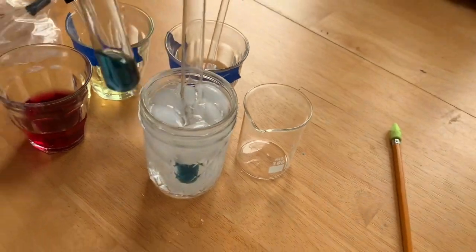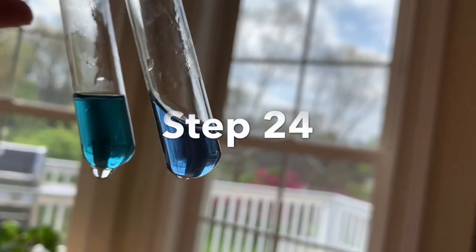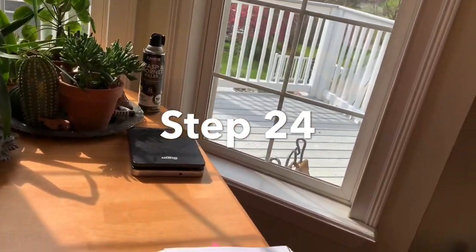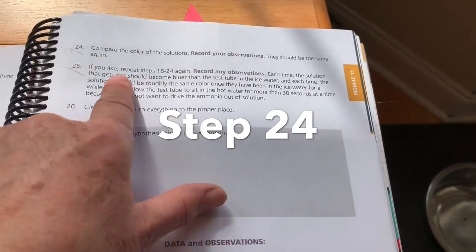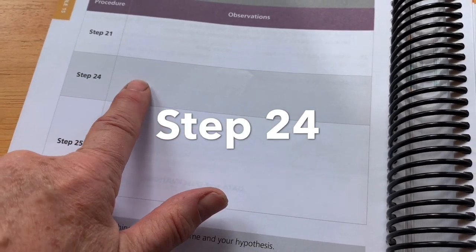So now we're going to put the one back into the hot water and do the whole thing again, to see if we can get a repeat of what we just did. Hot is here, the cold is the turquoise, and it happened again. So we're supposed to fill out our table on step 24, and we can affirm that it happened again.